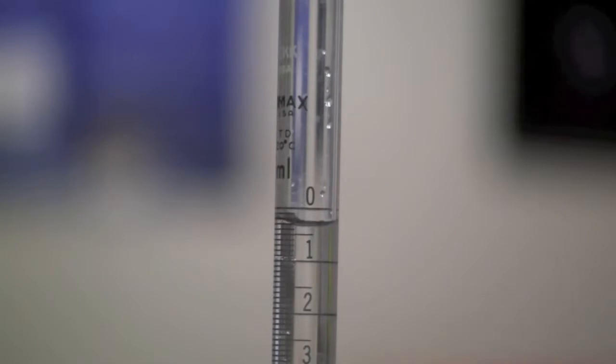Read and record the volume of sodium hydroxide in the burette by reading the bottom of the meniscus.